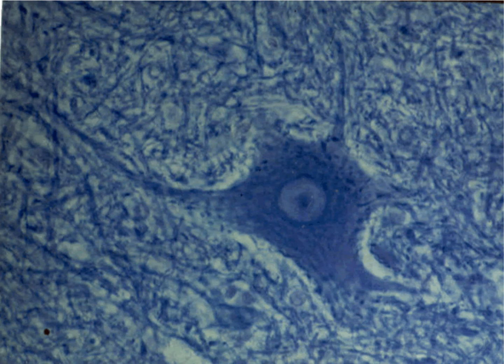This is a great picture that shows a neuron. I'm going to draw an outline around it. And this neuron kind of looks to me like a steamrolled octopus or a squid. You can see a nice nucleus there in the center, and it is surrounded by a cell body. These extensions that come and go from the neuron are called processes, and they may be an axon or they may be dendrites. When we get into the nervous system information later in this course, we'll talk more in detail about the setup and structure of a typical neuron.